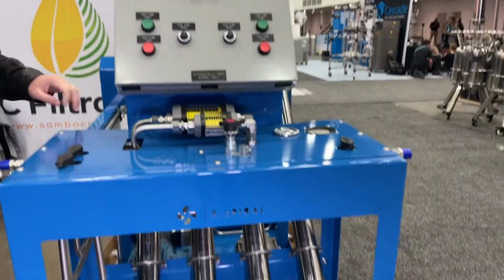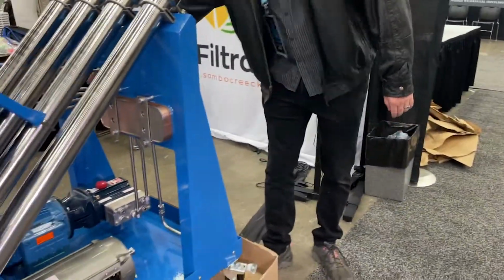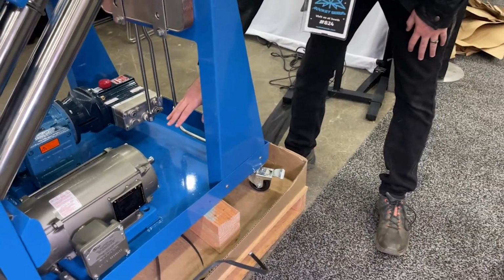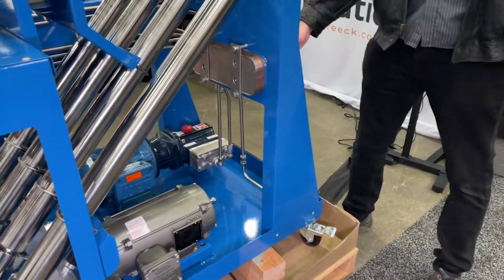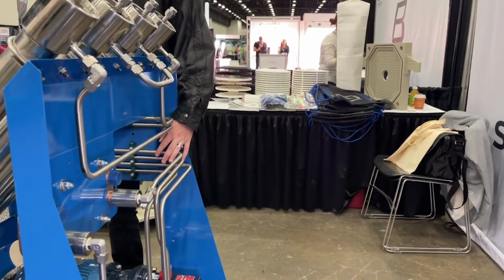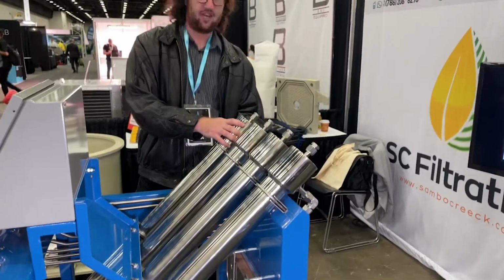From there, the fluid is further passed on to the loop pump along this line. The loop pump will accelerate the flow up to the proper cross flow speed, send it through a heat exchanger, and at new temperature it will be conducted back to the manifold to then go back and come out to the first filter housing up top.